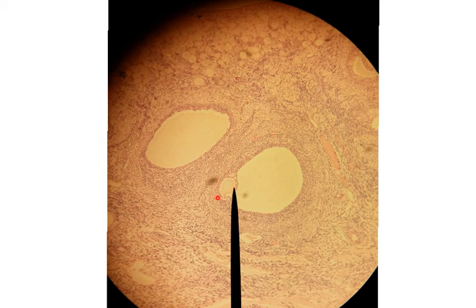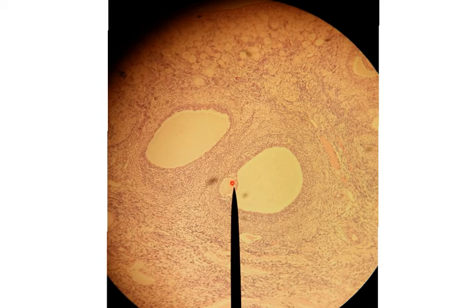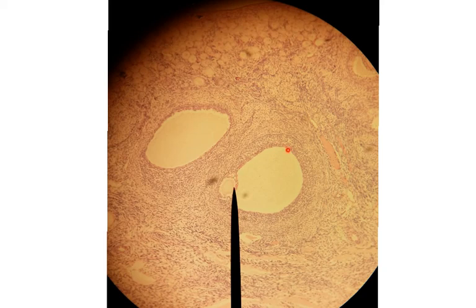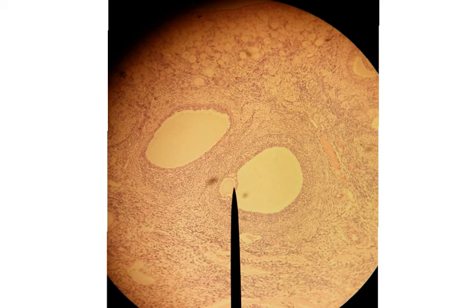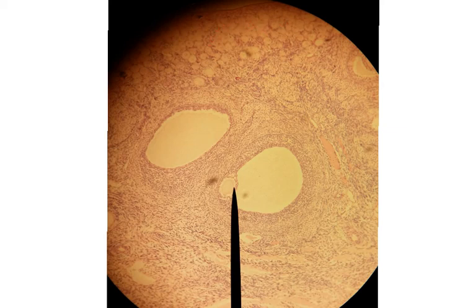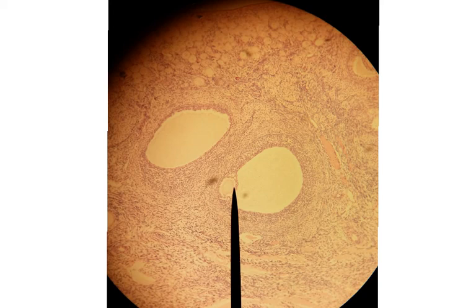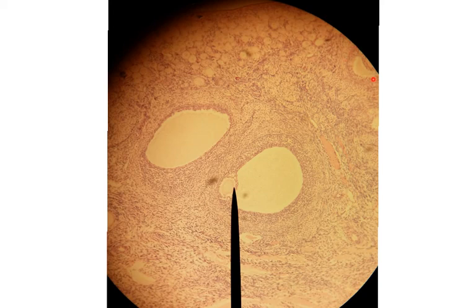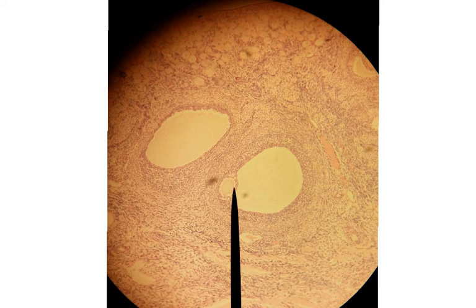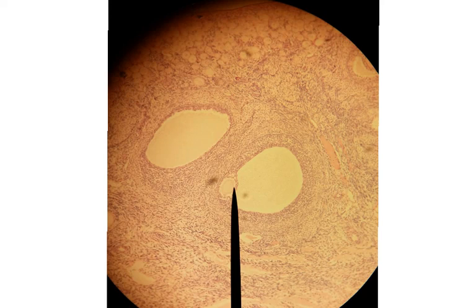Finally, we have the Graafian follicle, which is this entire large structure. The Graafian follicle has a few regions you need to know. On one side we have the mature oocyte, or egg, and this very large conspicuous open area called the antrum. Near the edge we see a cluster of primordial follicles. Here we see another antrum cut in such a way that we don't see the oocyte that goes with it. Over on the edge we can see just a bit of a secondary follicle evident by a developing antrum. So all of these past slides have been ovaries, just looking at different stages of egg development.